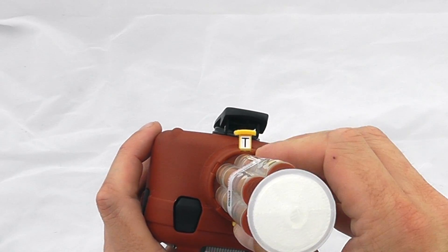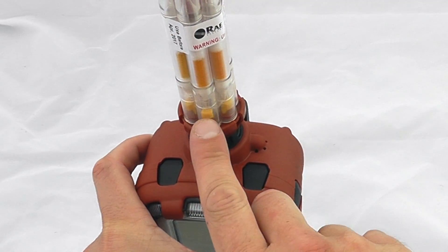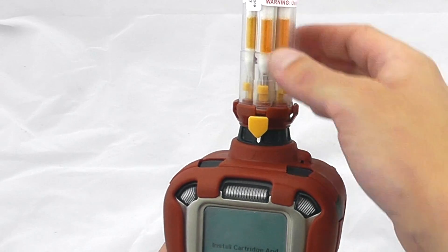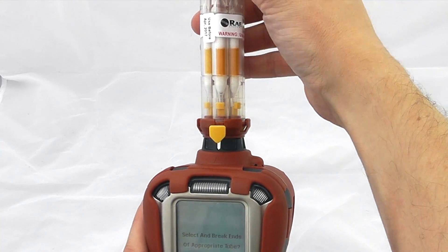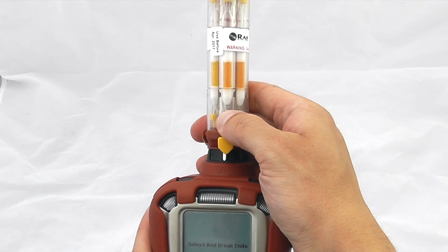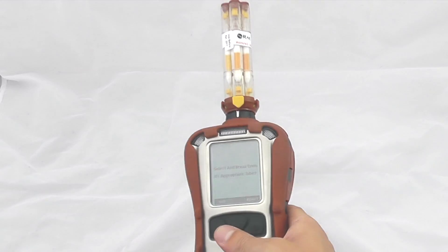To switch to benzene mode, we flick from the T at the top over to the B. This is now taking the sample through this front tube here, doing a benzene sample through this specific tube — the one that's lined up. The next step is to hit yes and it will say select and break the ends of the appropriate tube. We push down each of these yellow tacks and you can hear the tube snap. You can see that tube is now snapped and ready to take a benzene sample.